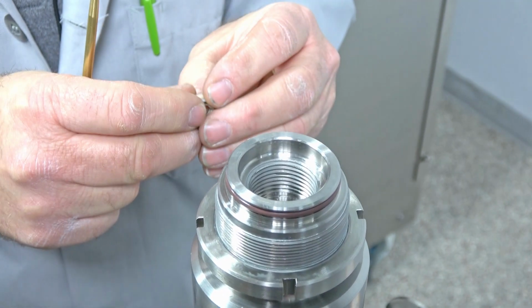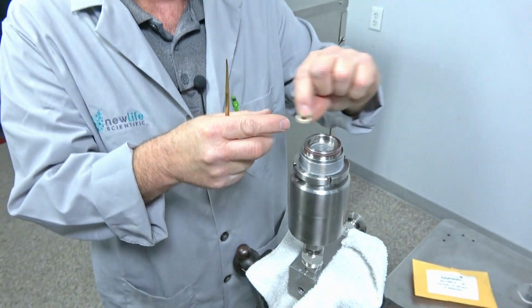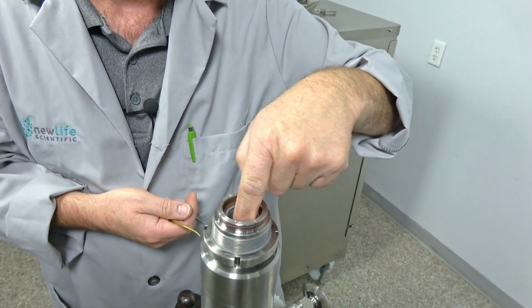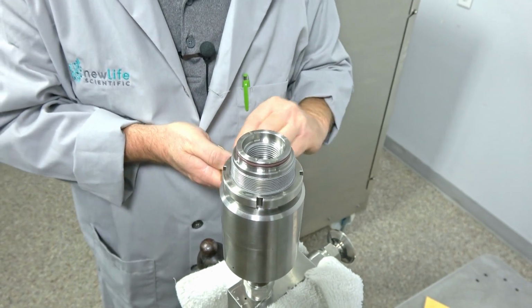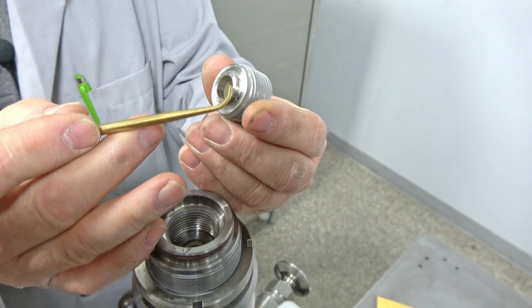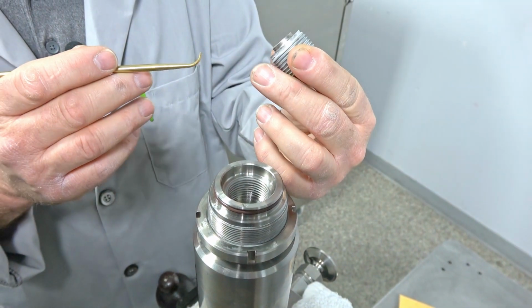So basically that's it. Once you get that, this one easily fits right in there. I just use my fingernail, my fingers, because I know I won't damage anything that way, just tucking it down in there, and then putting the plug back in. This will seat it to tighten it, push down on it, and get it right where it needs to be.